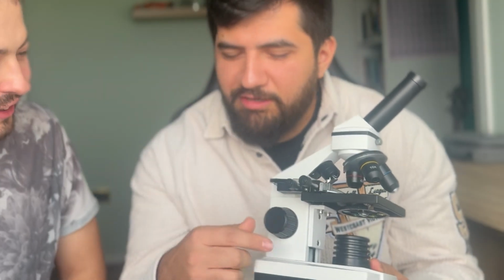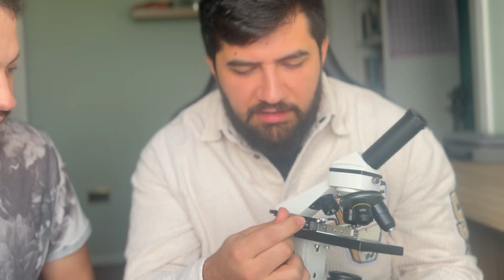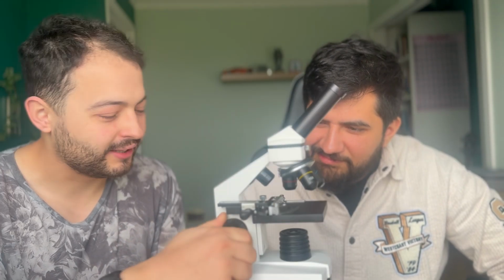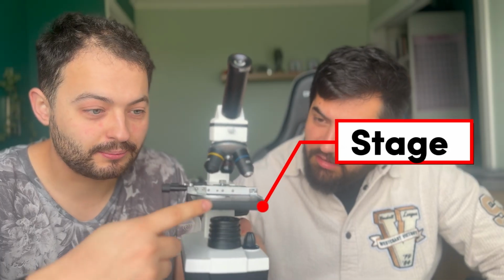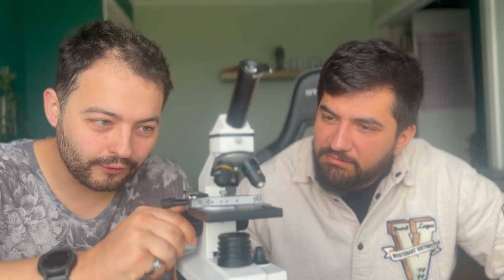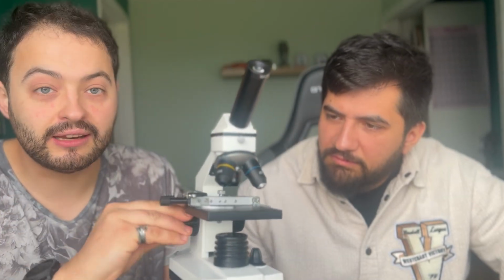I see loads of doohickeys here, and there's some here and one there. What do those do? All we're doing with this little knob is twisting it, and it gets closer to the stage, this plate right here where we put the specimens. It gets either closer or further away from the objective lens, and that's to get it in focus.